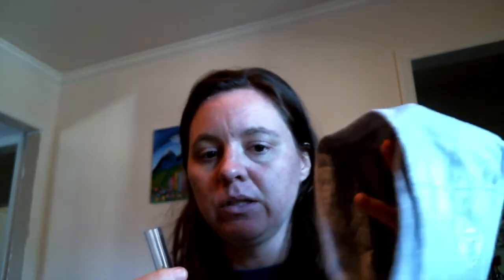If we're in school, we use these silver foil sleeves. I'm just gonna use a headband that I had lying around. You can use a piece of aluminum foil, a sock, a sleeve of your shirt, whatever. Okay, so again, with this one, we need to add 5 milliliters of water. So very carefully measure out your 5 milliliters of water.